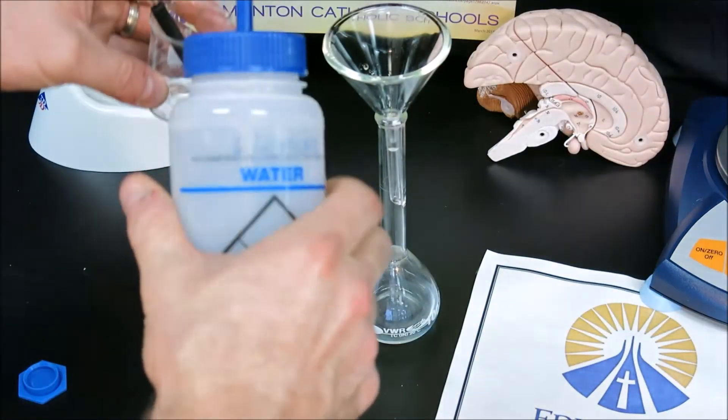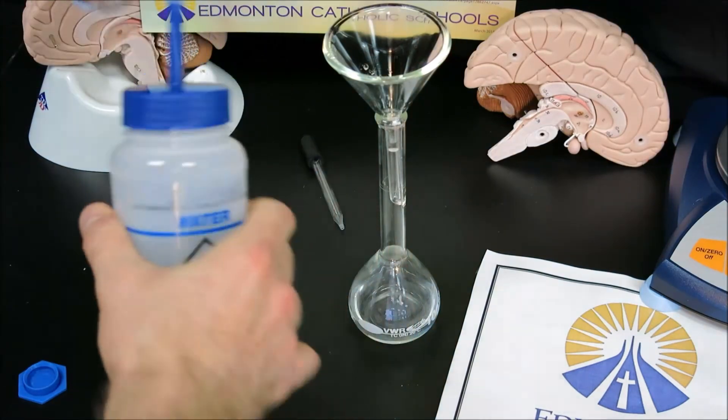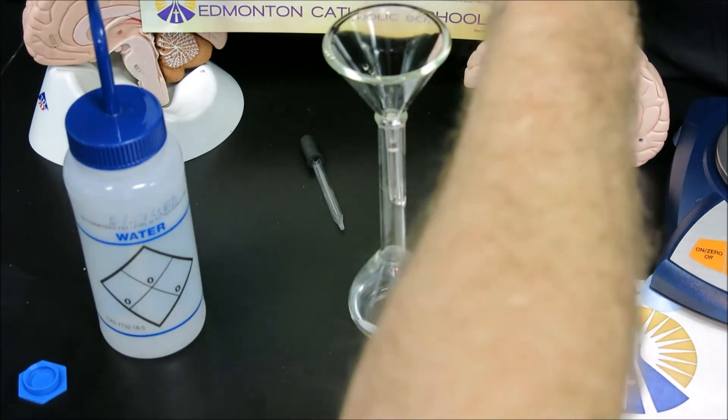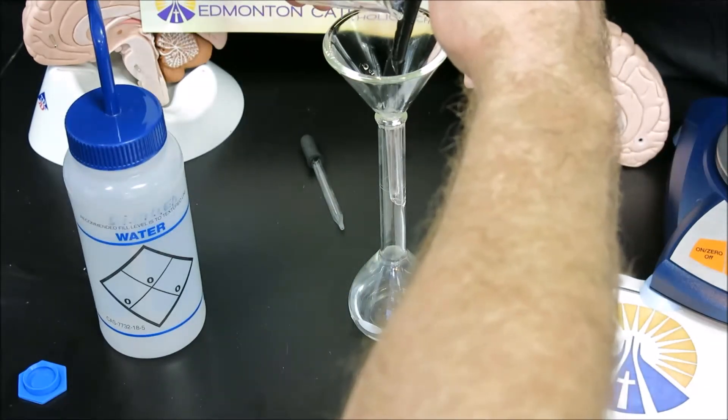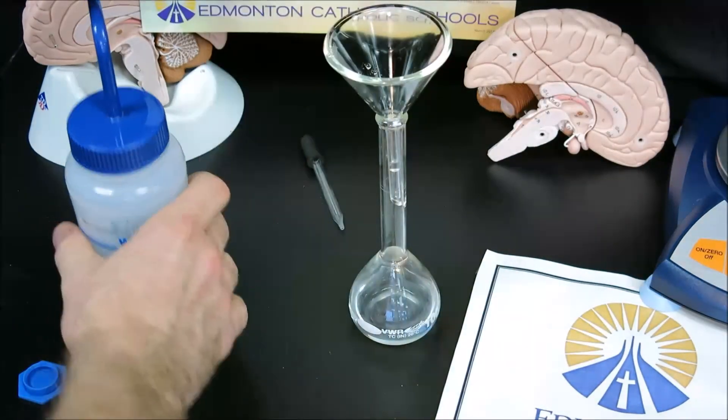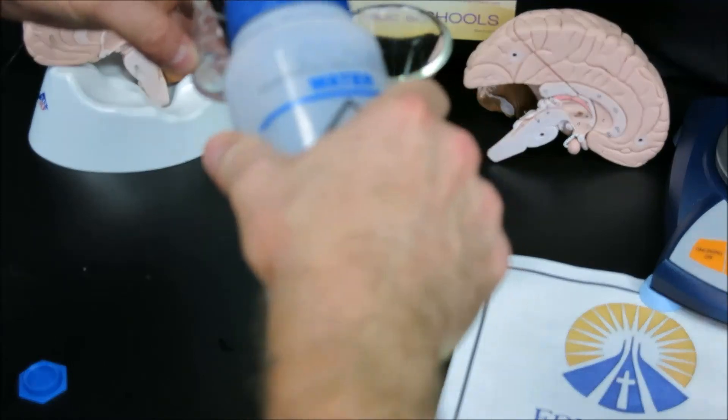I still have a little bit of solid at the bottom. As we stir this up and pour, that will be the last of the solid I could see with the naked eye. I now will do three clear rinses to catch the smallest particles.